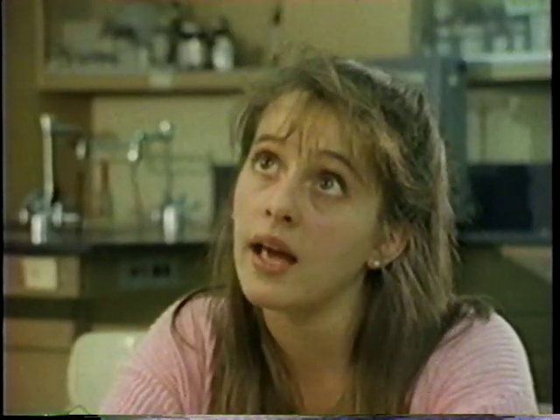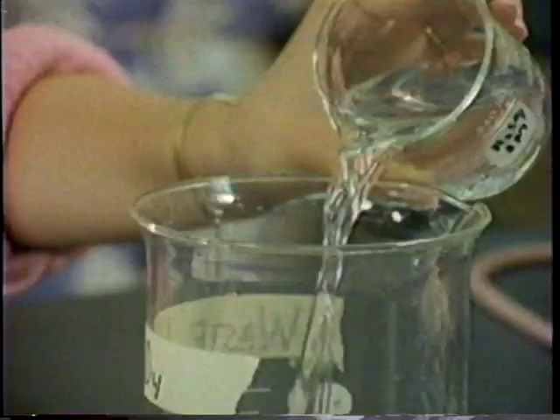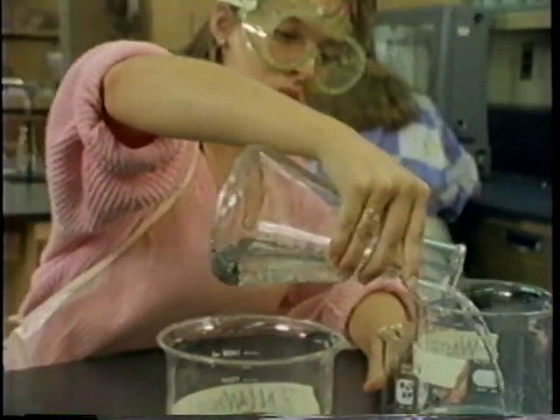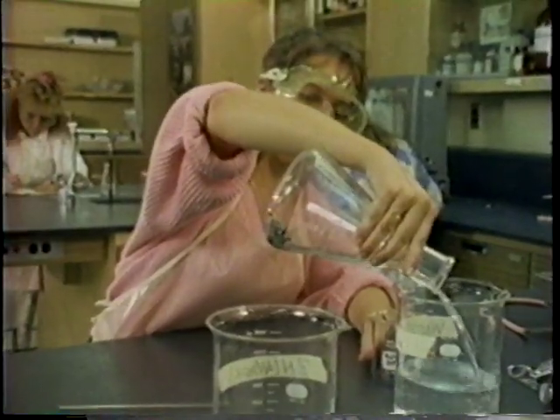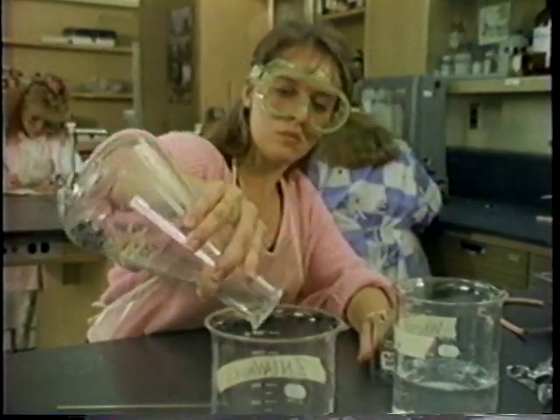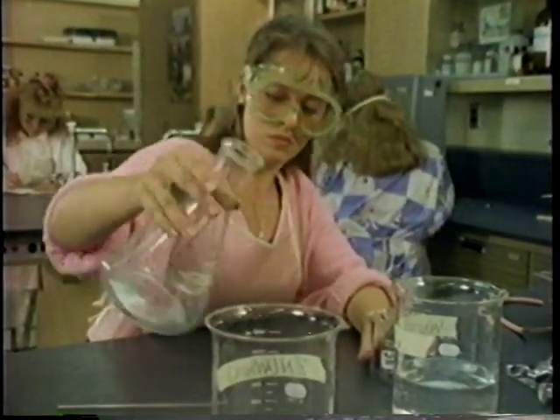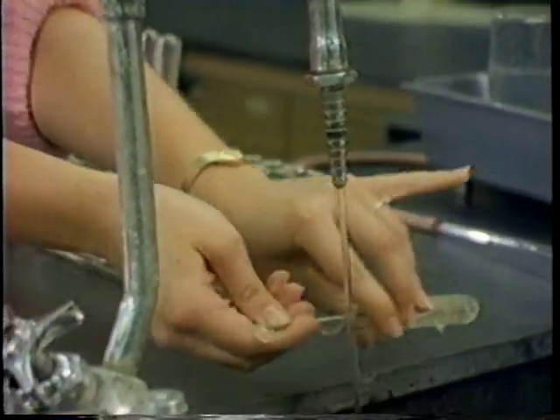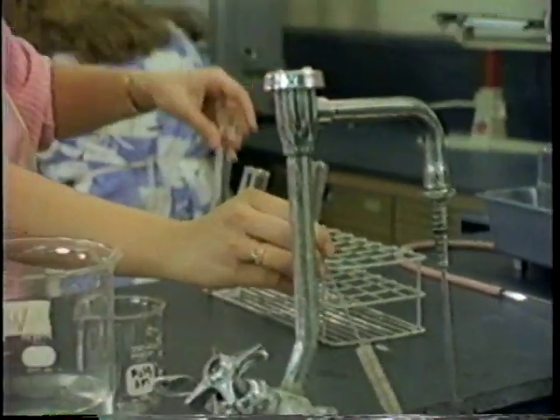The experiment went okay, and then I cleaned up, making sure to dump all the chemicals in the right containers. Never down the sink, unless Mr. Petrie tells us it's okay. And then I cleaned everything I used and put it back in its proper place. Okay, kid, you can go. That's it? I'm off the hook? Yeah, you're clean. Great. It was time to move on to somebody else.